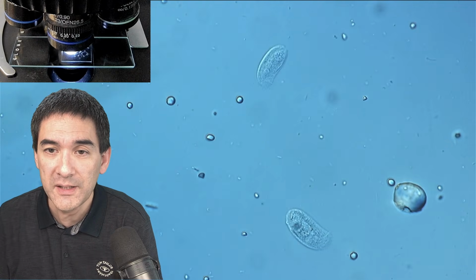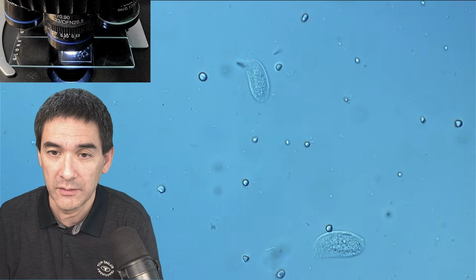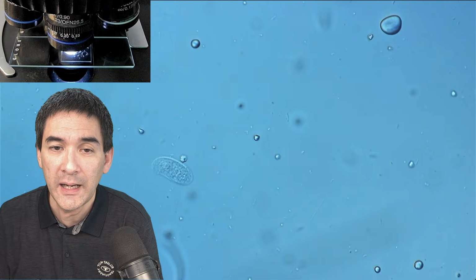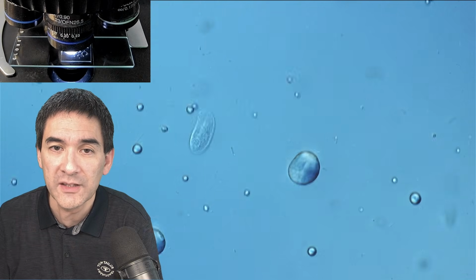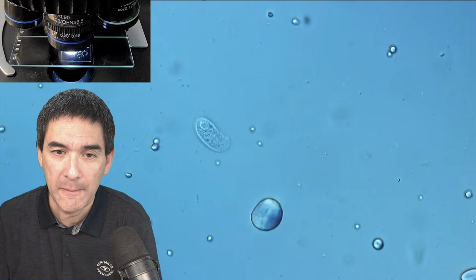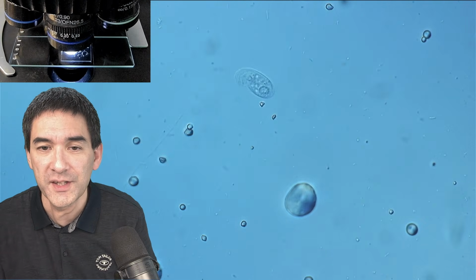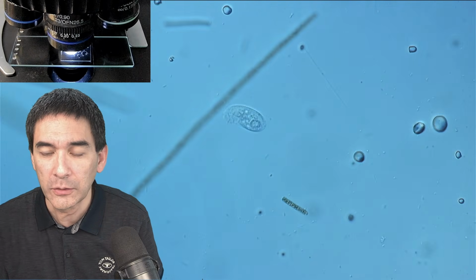And also for paramecia, I have experienced that they do like algae, right? Very often the starch that you add of the wheat grain will increase their growth, but very often they will be next to algae, I suppose, because this is also where oxygen is the highest. Because the algae produce oxygen by photosynthesis. I'm gonna call it basically. I call this chapter closed now.